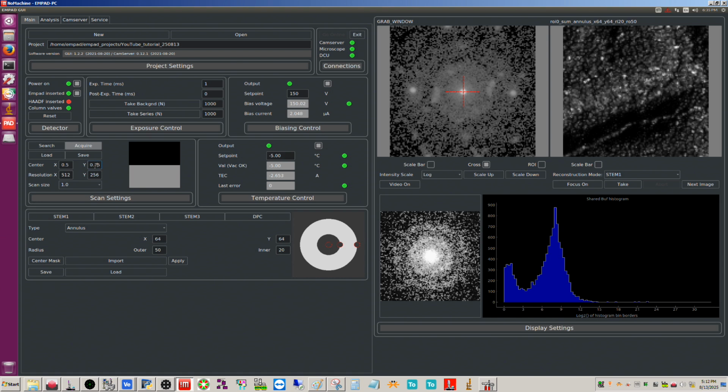If you're scanning the full frame from left to right, then you could adjust Y here like this. Sorry, that should be 0.5. But now you can also do the same thing vertically. We could do the same thing, and then if we wanted to adjust this, we could scan just the left, or we could scan just the right. And again, that's the middle.